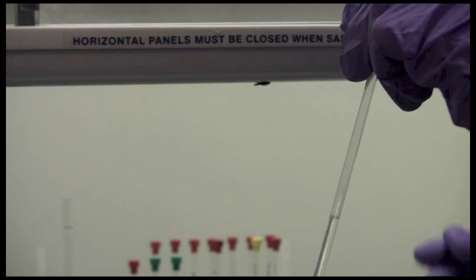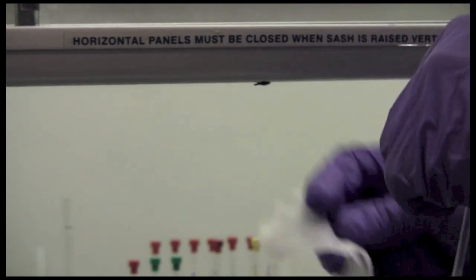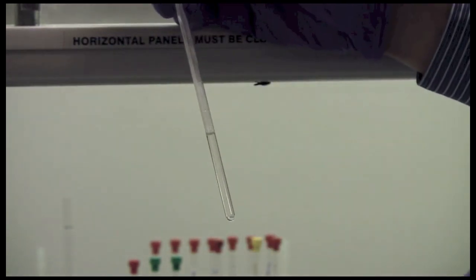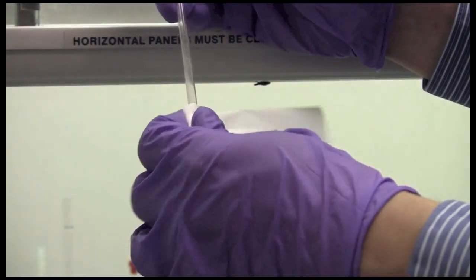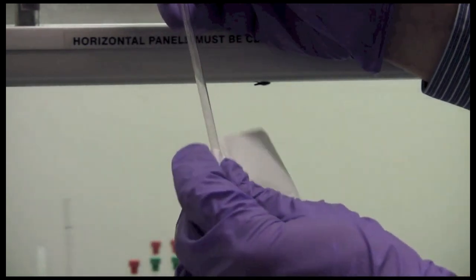Also if you have particles stuck to the outside of the wall or fingerprints or other issues on the outside of the tube these can also cause problems. So before you put the sample into the instrument it is a good idea to wipe it down with a Kim Wipe.